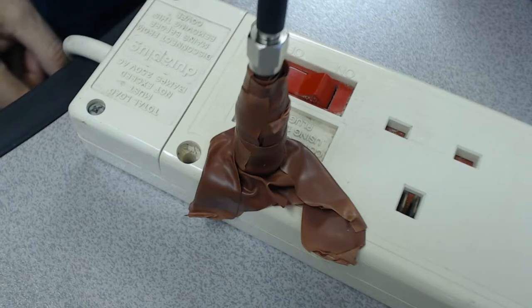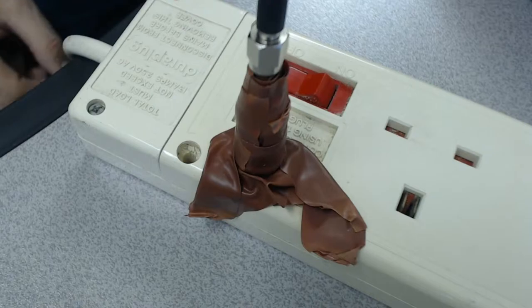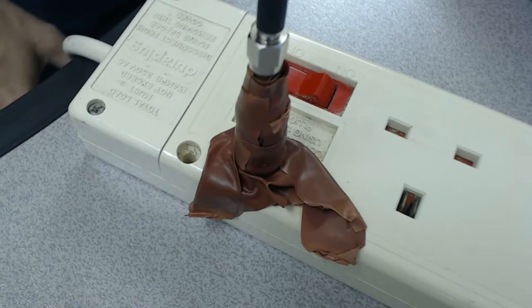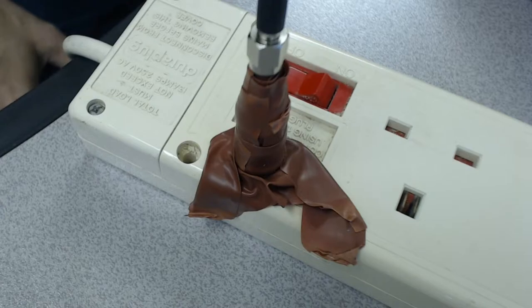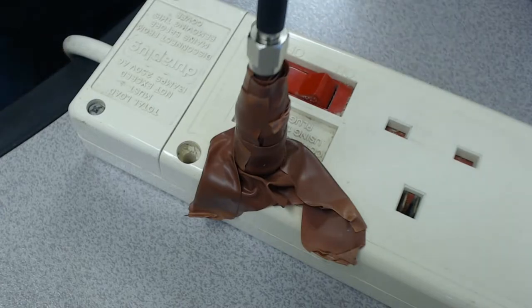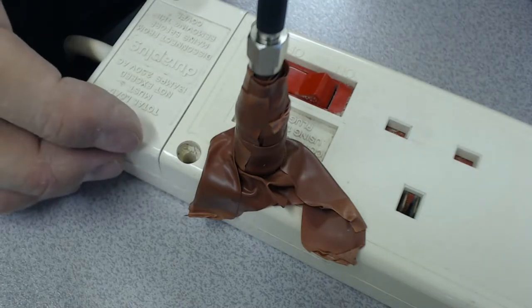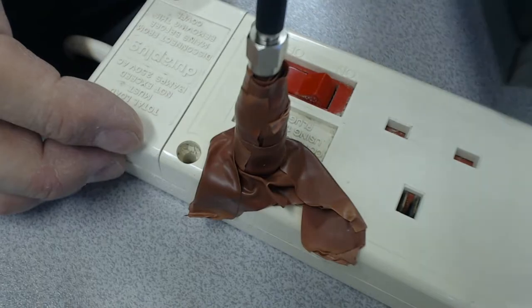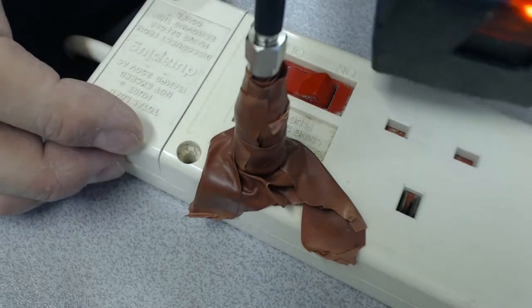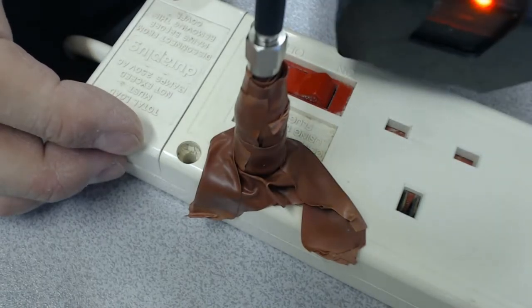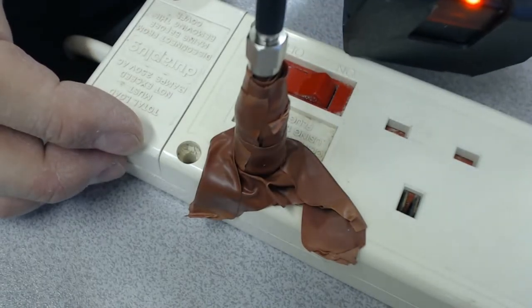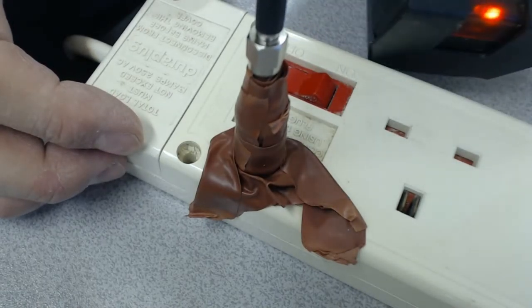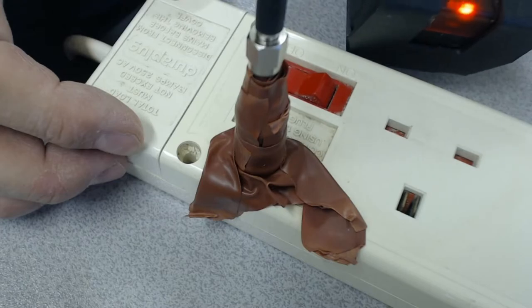So I was thinking, where am I going to get a neon light from? It's a case of one man's junk is another man's treasure, and in this case it's the same man's junk. I have a number of these power supplies. You can see here, this is another power supply and that is a neon light in there.